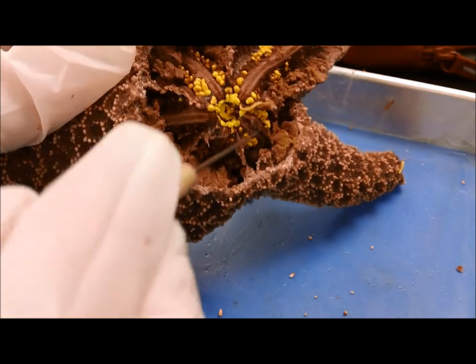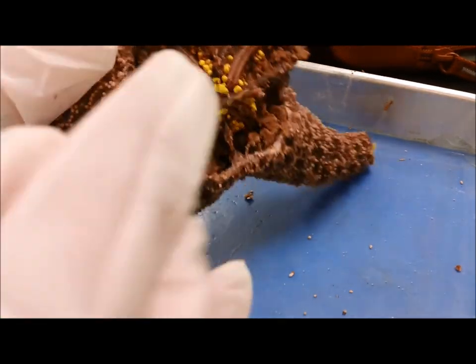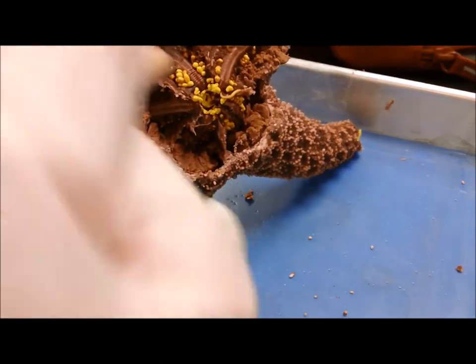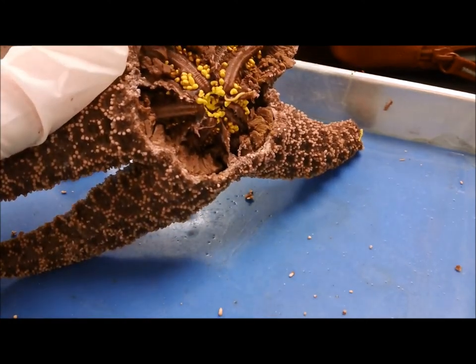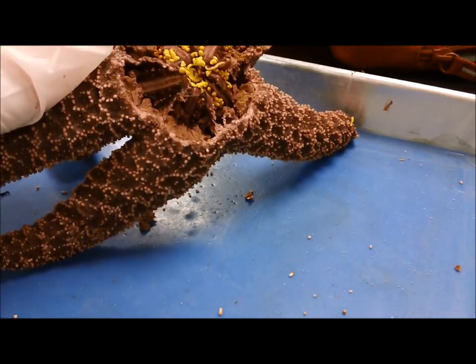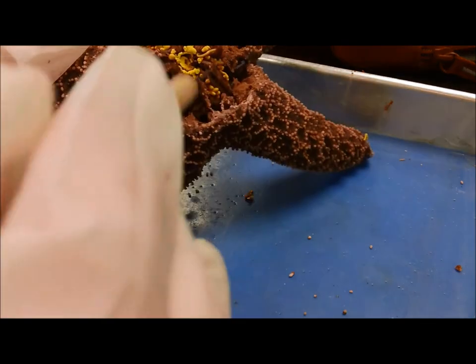And this here is the ring canal that all the radial canals attach to. You notice how they're kind of segmented — and that's how it can bend. If these here weren't segmented, it wouldn't be able to bend. Kind of like our vertebrae: if we just had one bone there, we'd just be straight. But because you have a whole bunch of little bones, it gives you that segmentation and allows you to bend more completely.